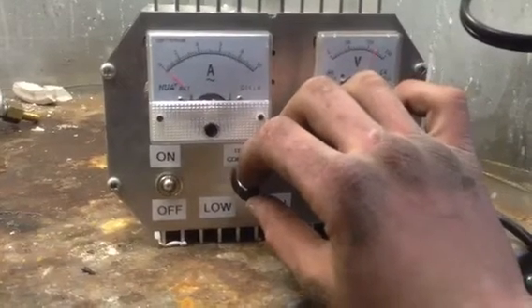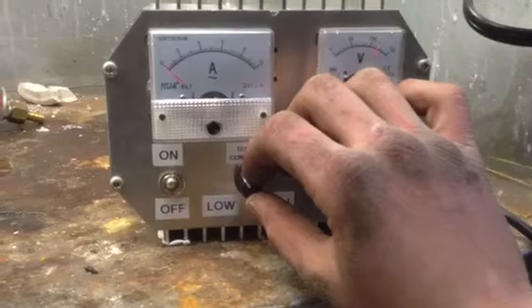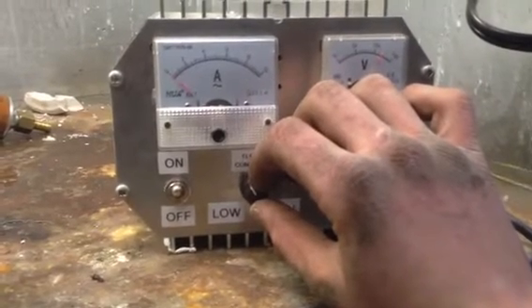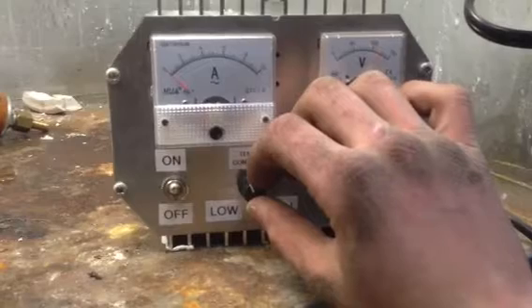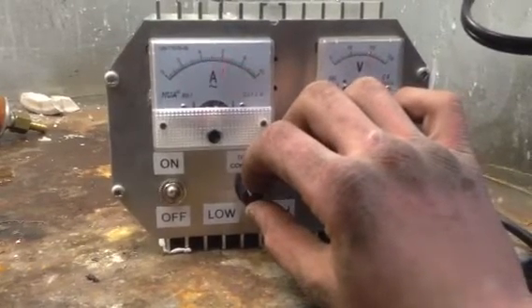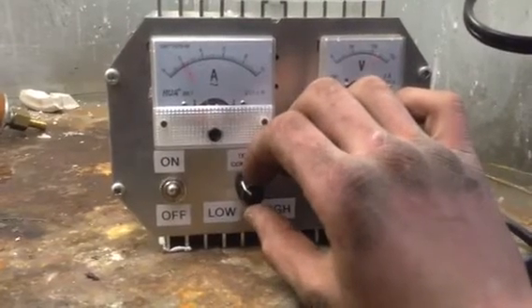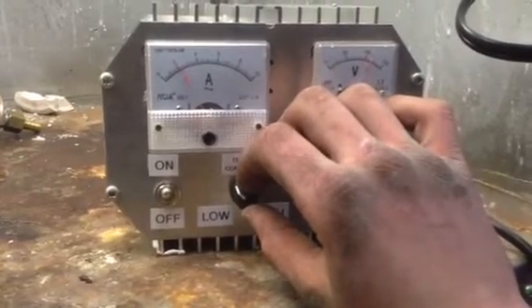When you turn it back up it's not going to fire up, when it does it's going to jump to like 5 amps and you're going to want to turn it down right away. As you can see when I'm slowly bringing it up here it jumps and you're going to want to bring it back down to wherever you want to set it. So that's just a warning for any of you guys that want to make this.